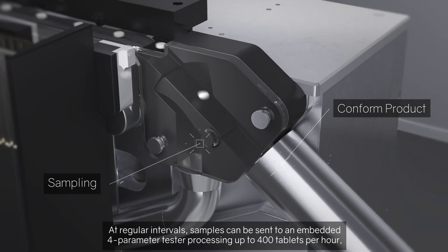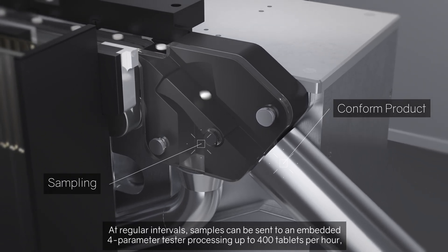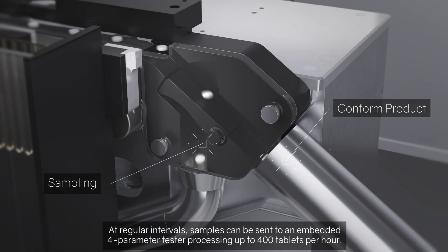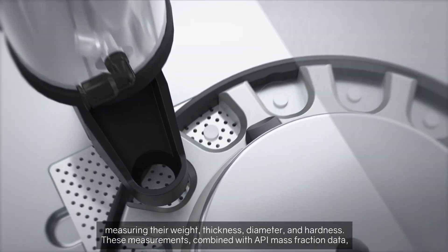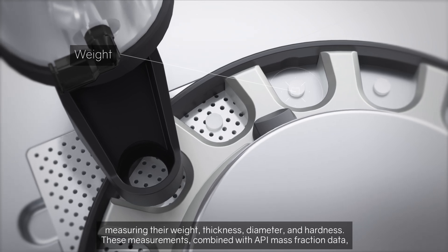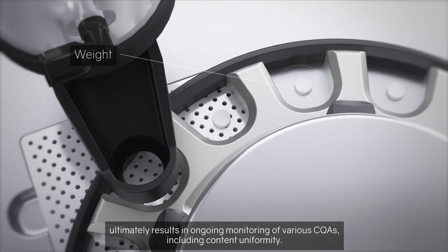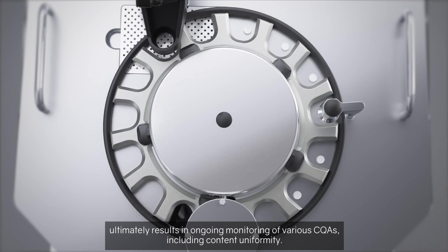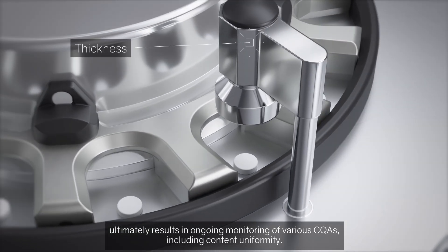At regular intervals, samples can be sent to an embedded four-parameter tester processing up to 400 tablets per hour, measuring their weight, thickness, diameter, and hardness. These measurements, combined with API mass fraction data, ultimately result in ongoing monitoring of various CQAs, including content uniformity.